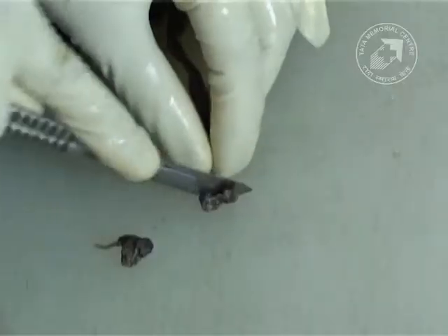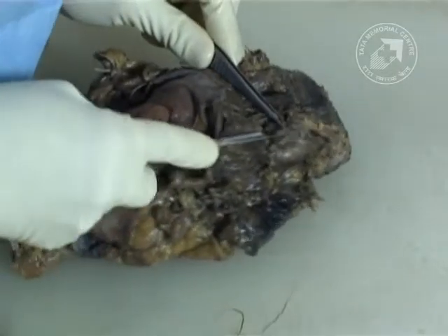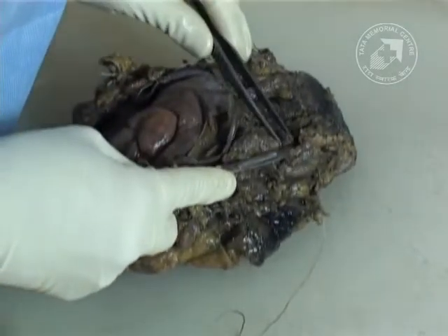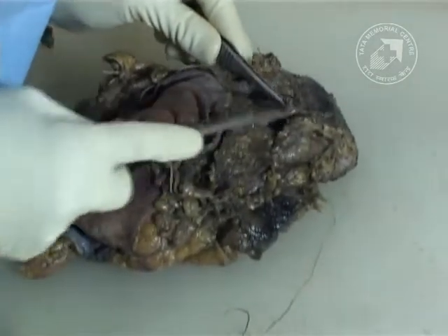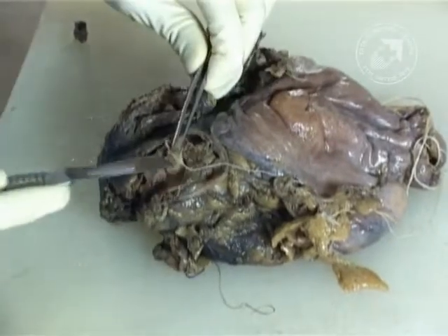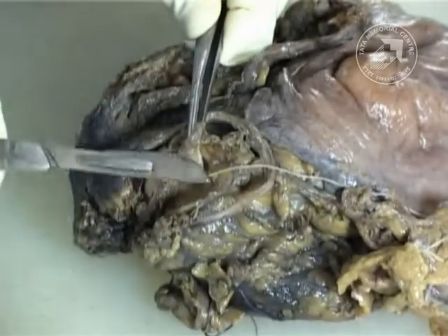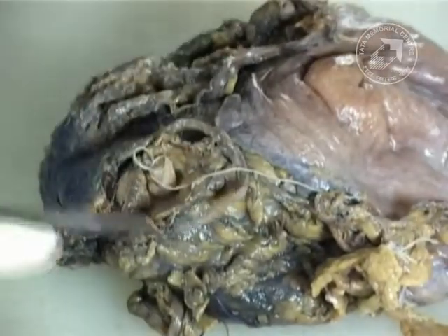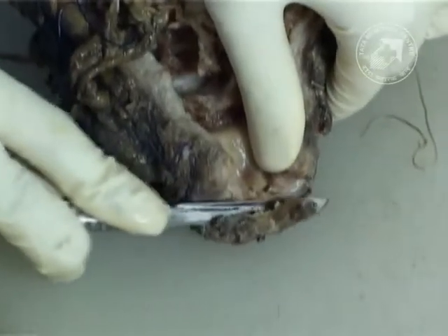These are the cut margins which we take of both the vas deferens. After taking measurements, this is the cut margin of one of the ureters and the cut margin of the other ureter. Then we take the cut margin of the distal urethral cut margin.